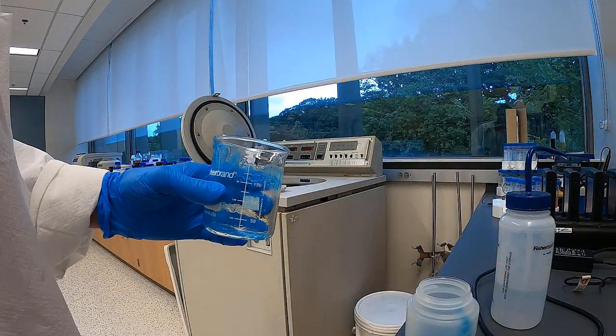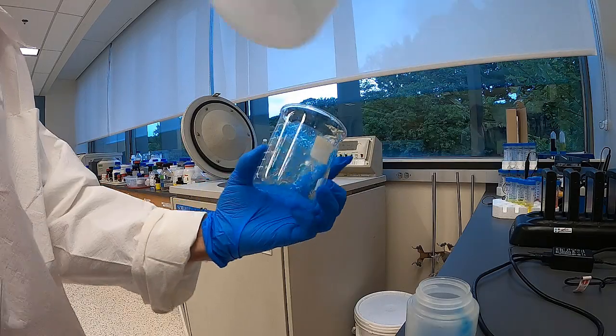What I'll do is give it a deionized water rinse.